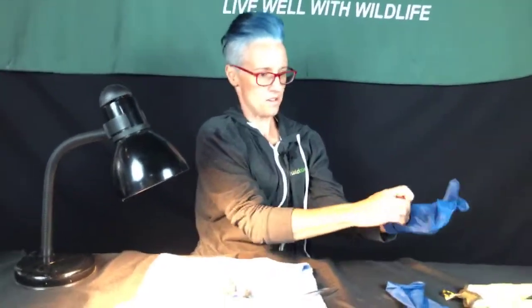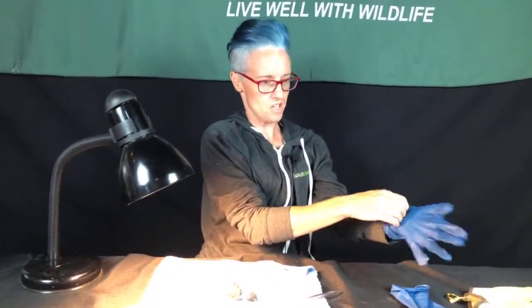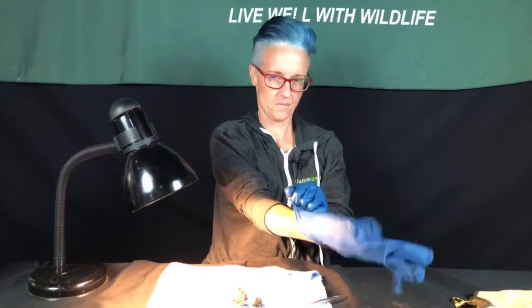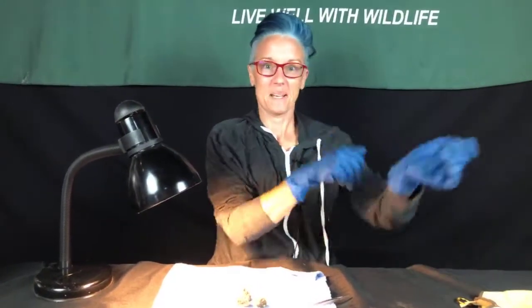It's owl puke, and it's probably got some nasty stuff on it, you know. Could be. They don't really smell well either, so just in case anybody ever does this, it's like, ugh, these are gross. I have to say, every time I find an owl pellet when I'm out hiking, I immediately grab it and start ripping it apart.